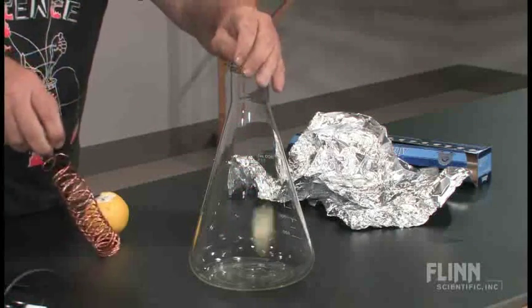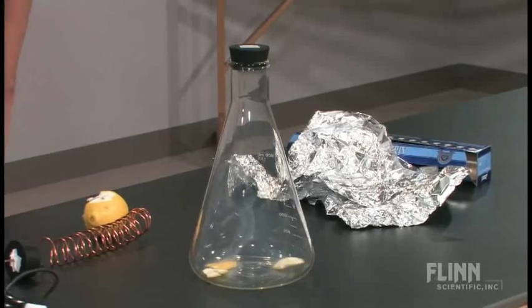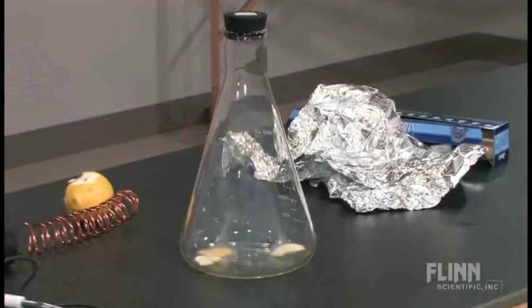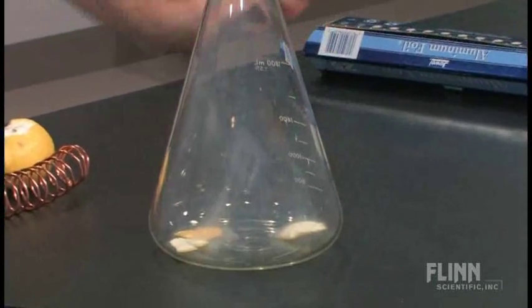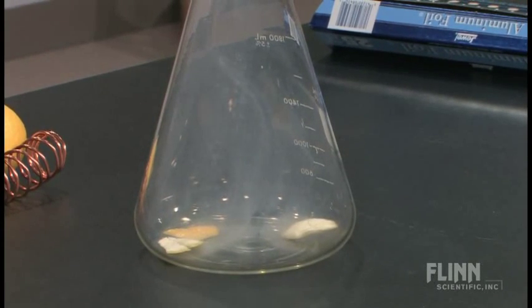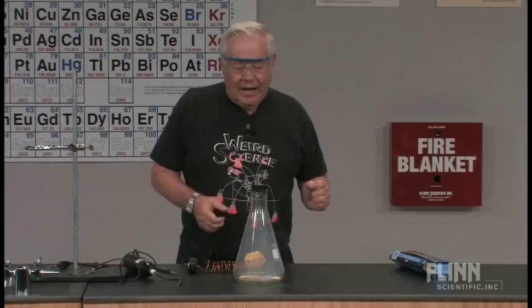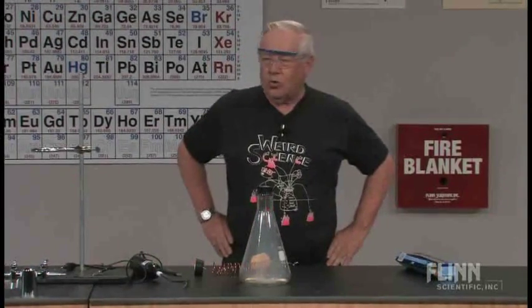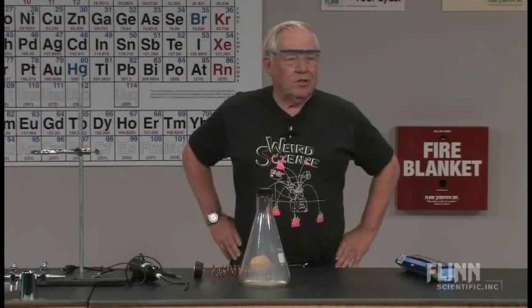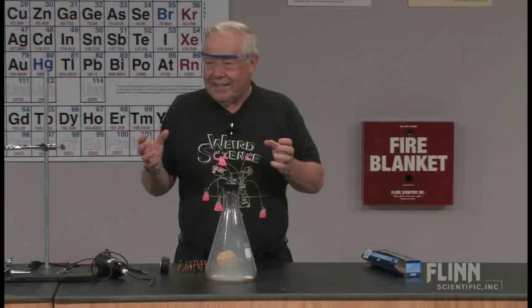There we go. And now we will see what will occur. You can see coming up from the peel — there is a reaction going on between the limonene, which is an unsaturated hydrocarbon, and ozone. This is similar to what happens in LA and other places with automobile exhausts, which contain unsaturated hydrocarbons. Ozone is going to add oxygen atoms to the limonene and it's going to make what is called a carboxylic acid. That's what happens when we get smog. Smog often smells sharp in your nose because smog is generally acid-like — it contains some acid molecules.